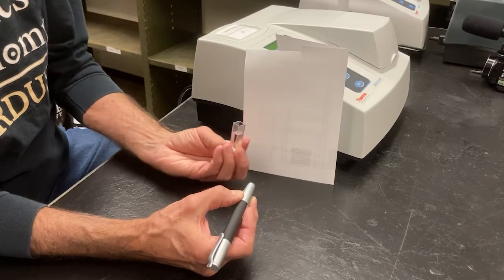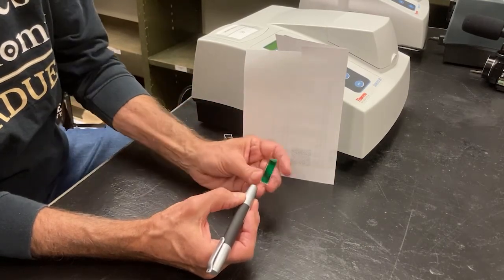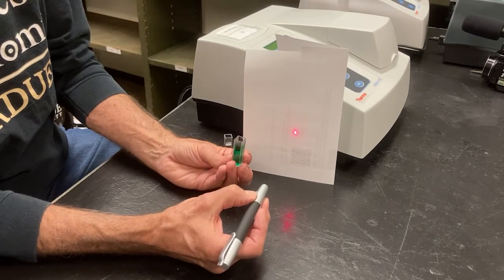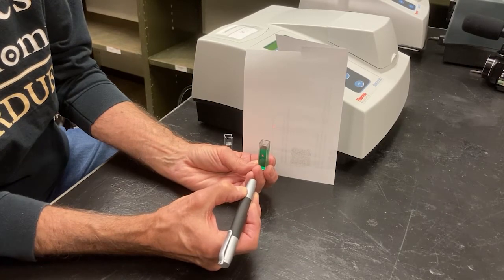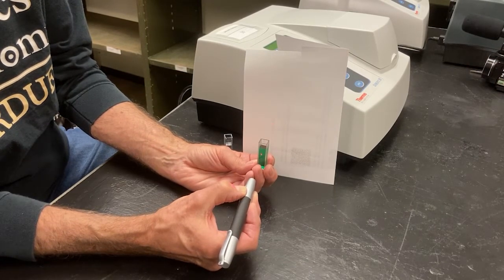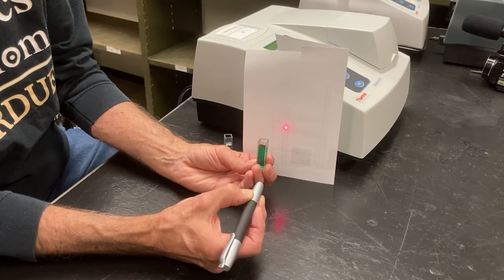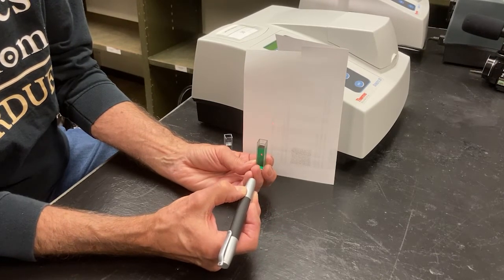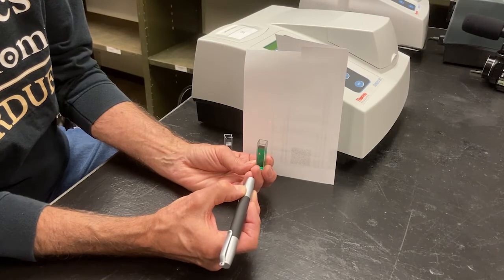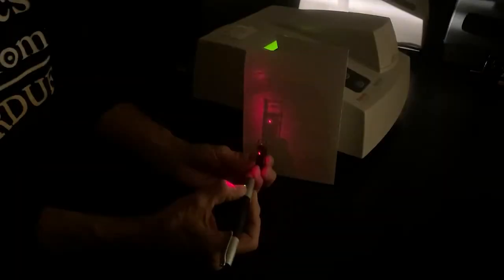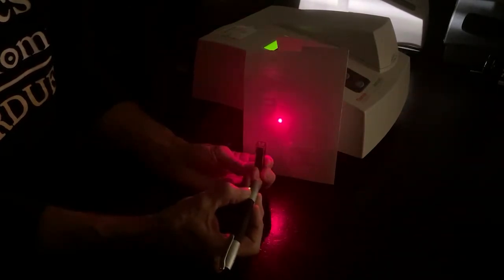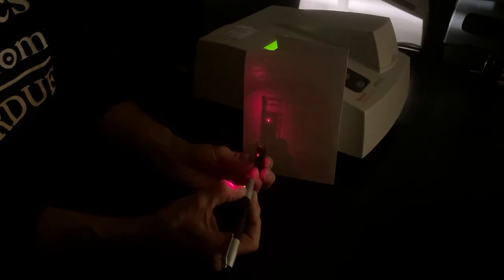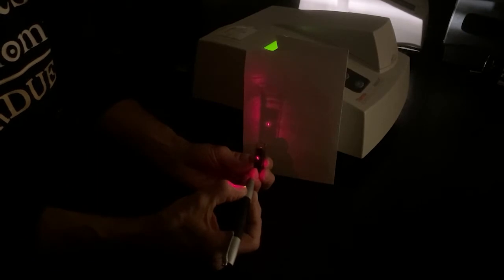Well, just for comparison, let's try that with a green solution. There's my red light. We'll pass it through the green solution. Whoa. And what do you see? Not much. Not much. No green. Green. I'm going to turn the light off, Dave, because we can see maybe that difference there, because I can't quite see it when you go. Okay. No green. Green. Wow. So, the green solution is absorbing a lot of that red light.